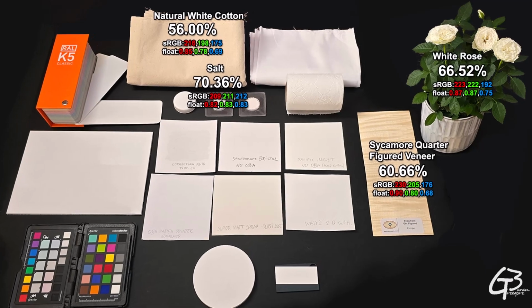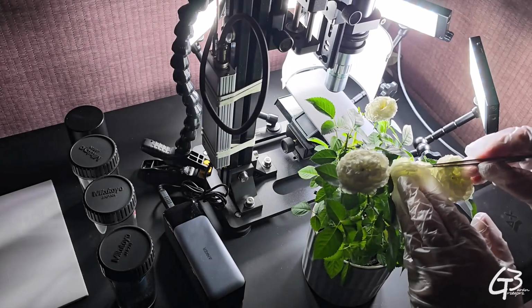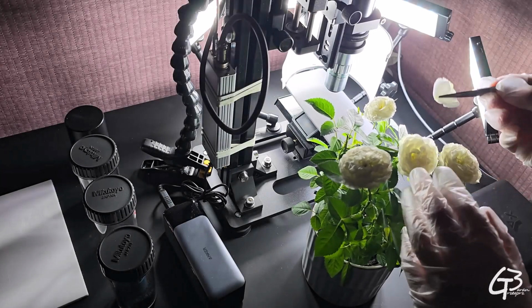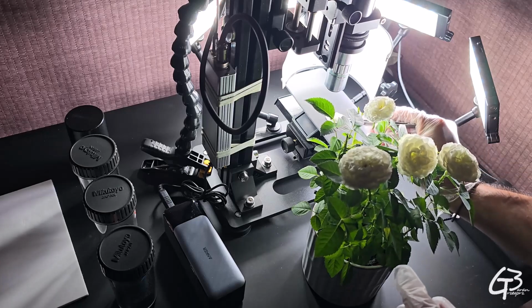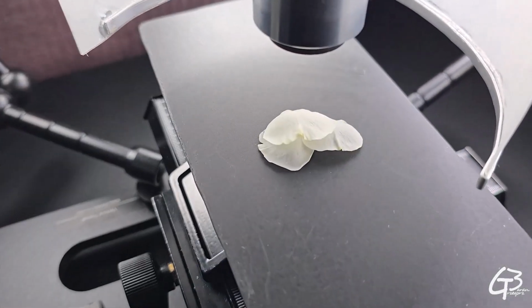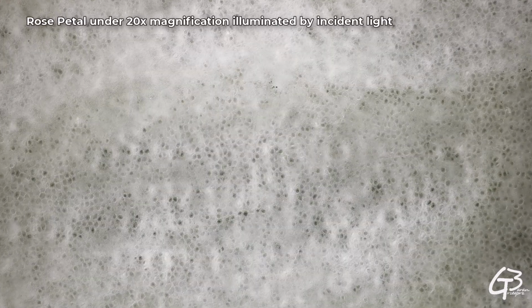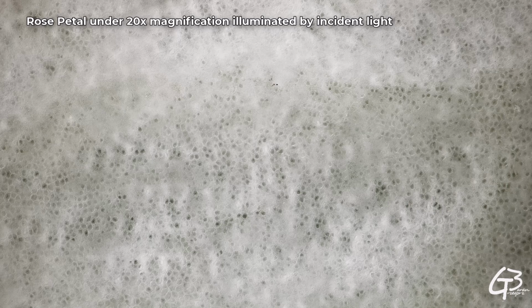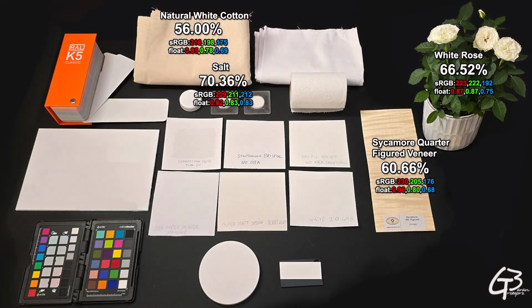Petals of white rose are even brighter, as they reflect 66% of the light back. So far, the white rose petals are the whitest, non-artificially brightened flower petals I ever measured. This is how rose petals look under magnification. It's actually pretty thin and has a lot of micro holes, which let light pass through and never come back to the observer's eye. Still, the reflected 66% is quite a lot.